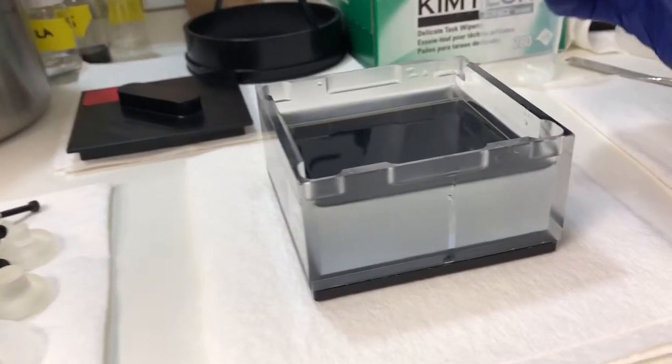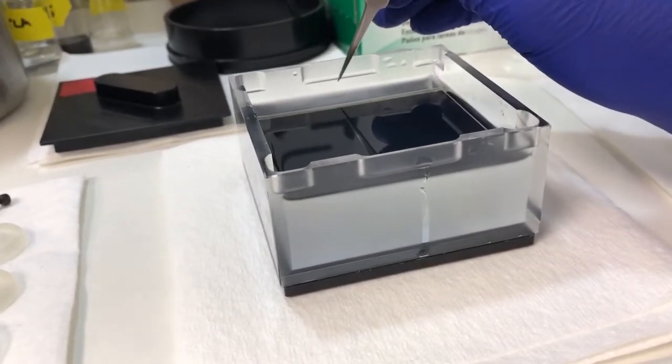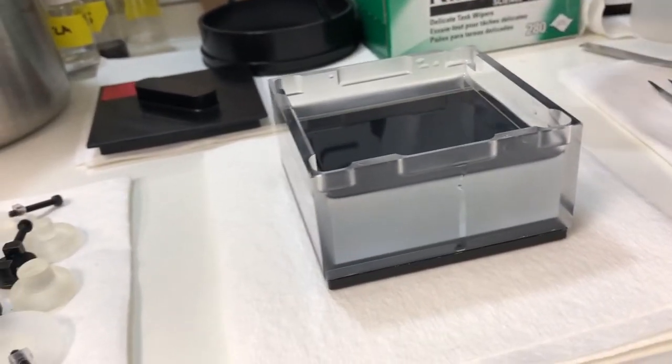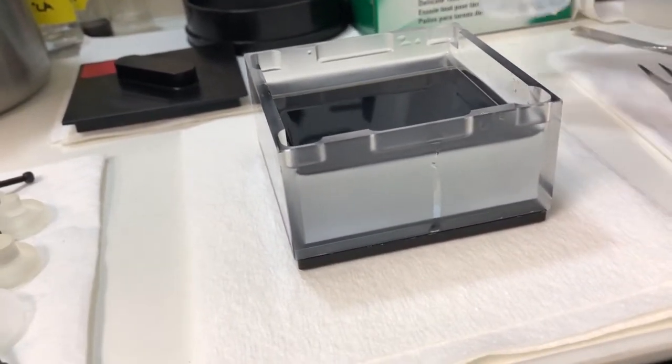So we need to, when we replace it, fill it up to here. If someone complains that something like this is going on, just fill this a little bit and then from here pour into the cuvette.